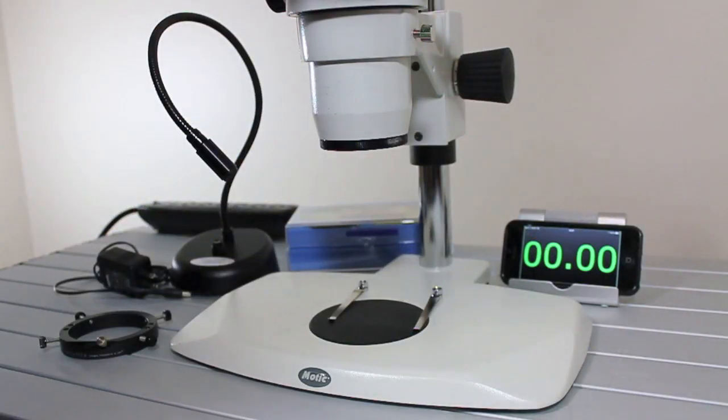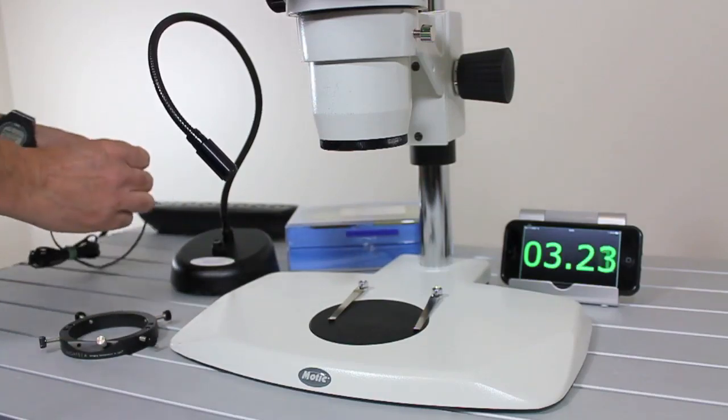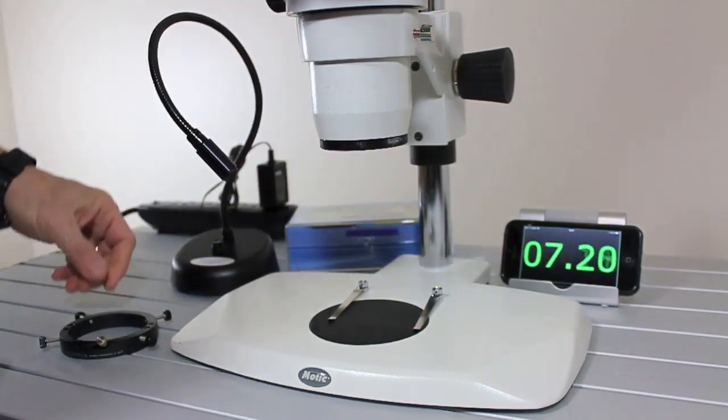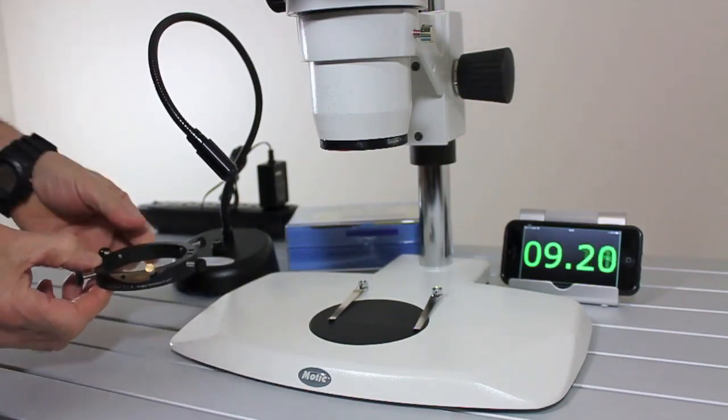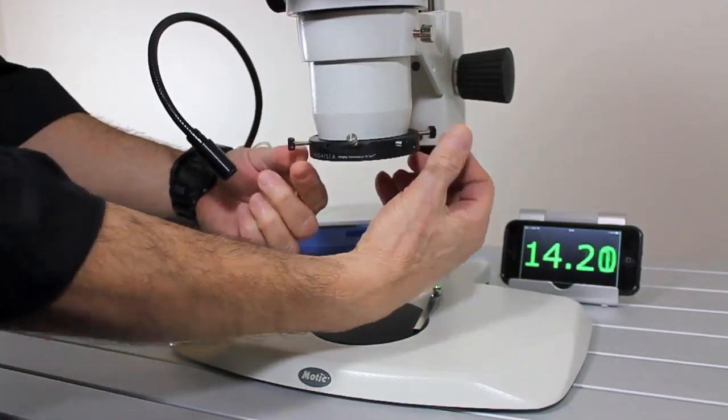I want to show you how quick and easy it is to set the system up on your microscope. Plug in the power supply, adapter ring just slips on, tighten the thumb screws lightly.